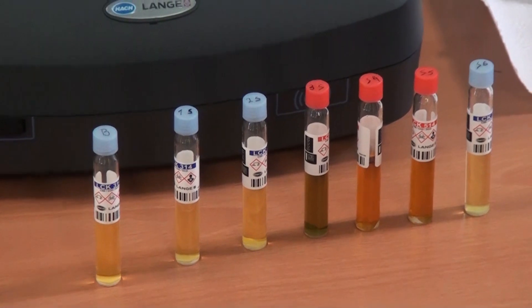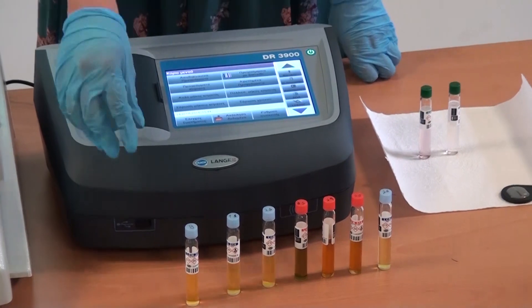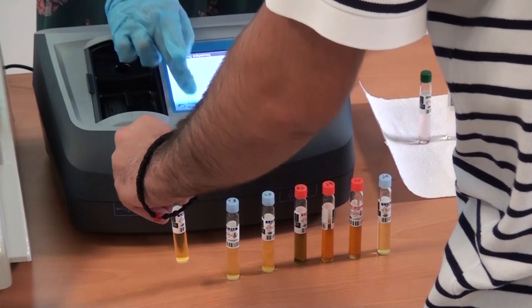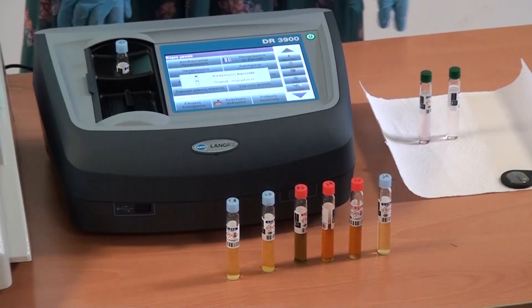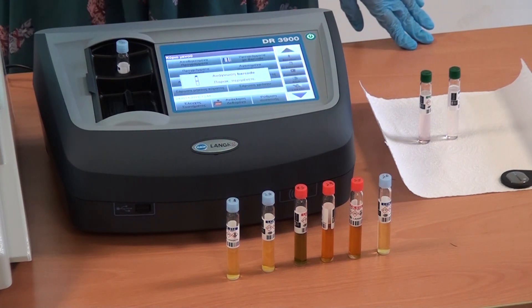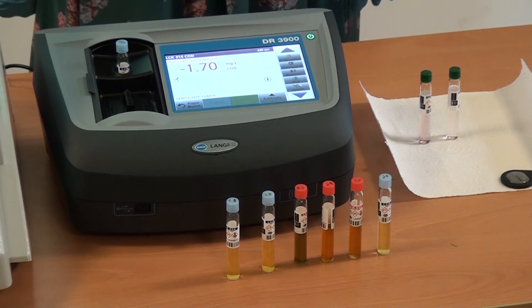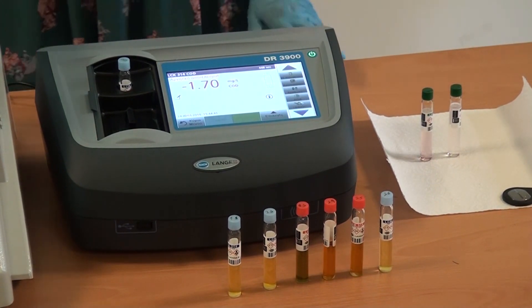Would you like to begin with a blank? No. Just put the first one. Back to the menu.